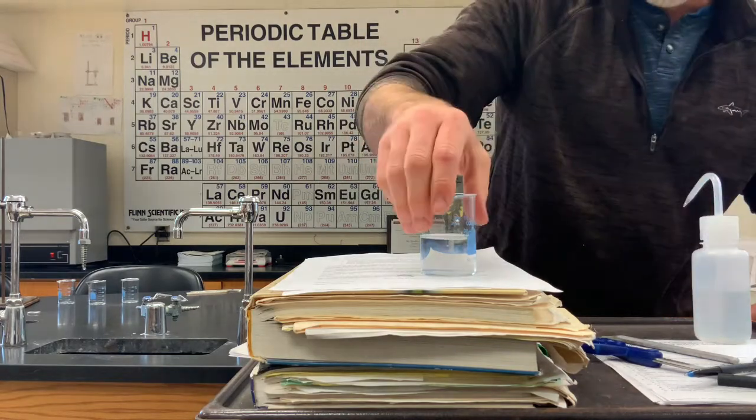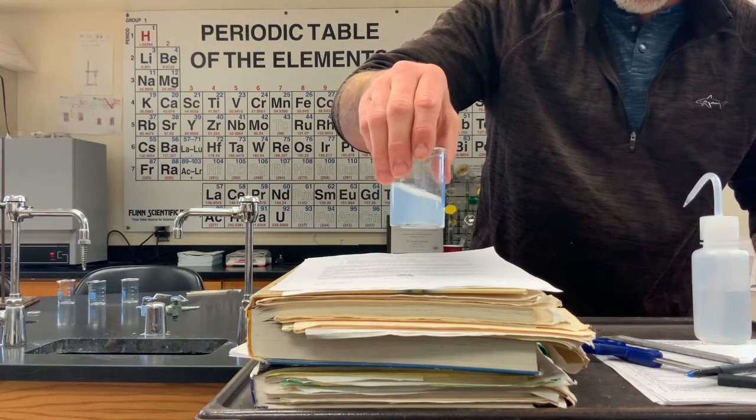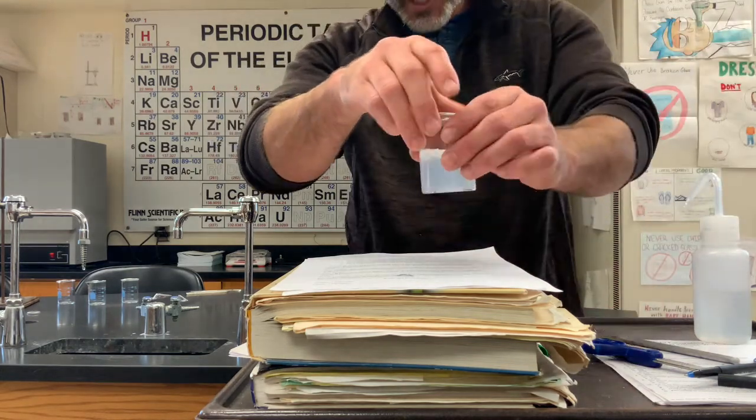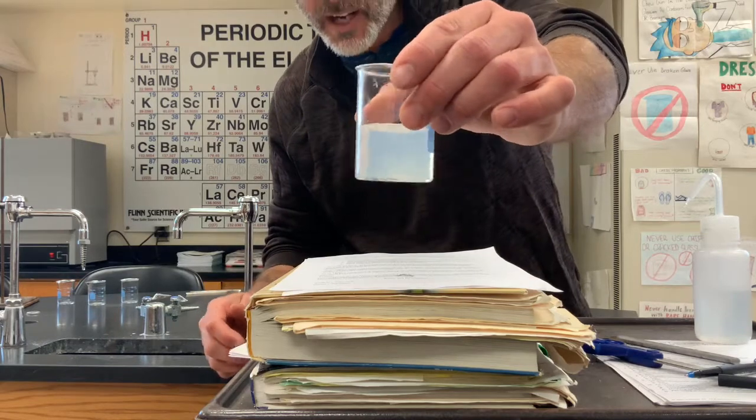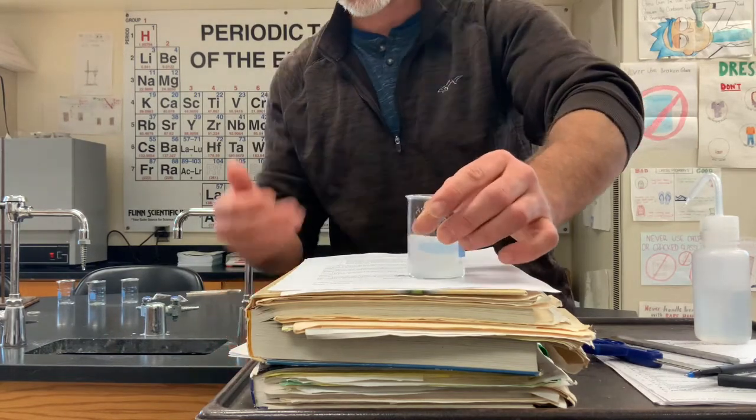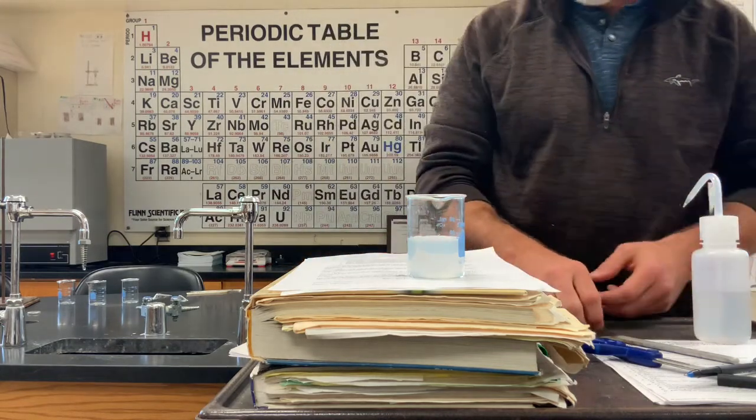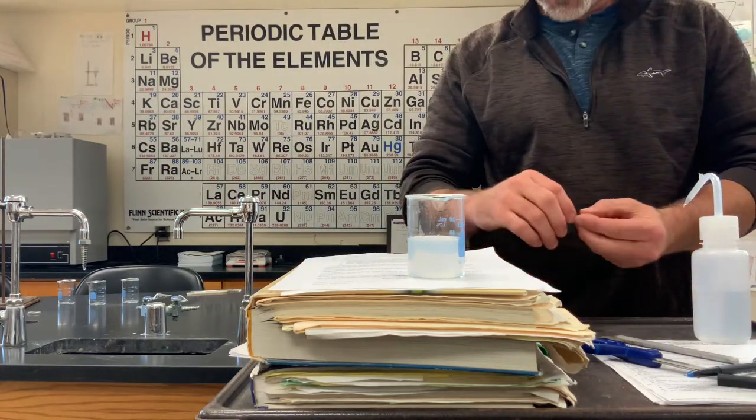So I'm making an aqueous solution of silver nitrate. We're going to let that work for a second. Swirl it around. Now you can see a slight tint maybe on camera. That means there's just impurity in my water. I thought it was perfectly distilled. Apparently not exactly. However, it still is going to work beautifully.